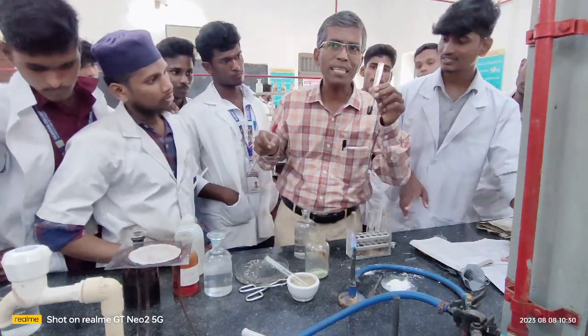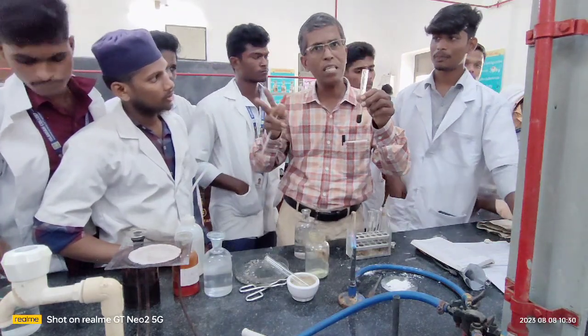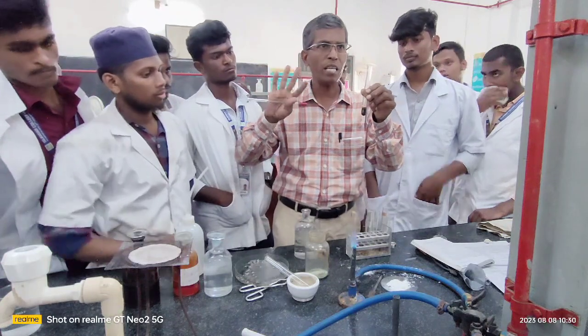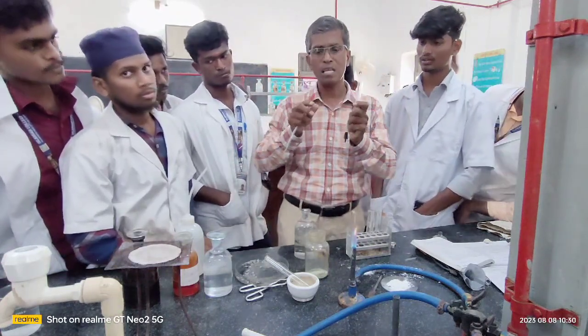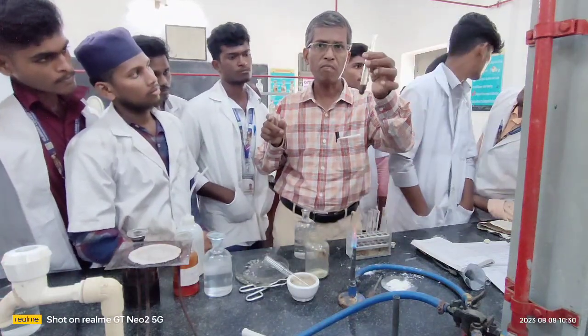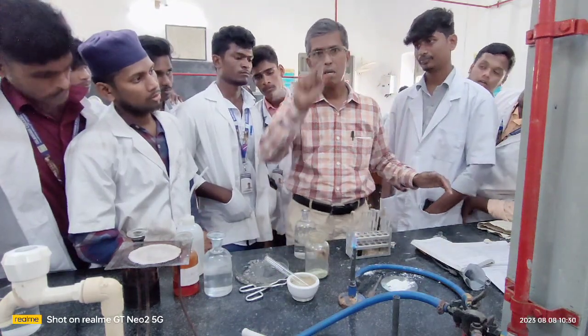Remember, you can use either dilute sulfuric acid or dilute hydrochloric acid. No problem in using dilute sulfuric acid. You can use either dilute HCl or dilute sulfuric acid. It is a little hot, I feel. Therefore, keep it some more time. Wait for some time. Pass it.